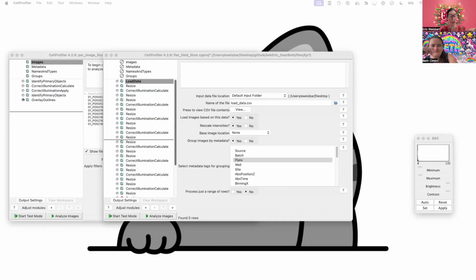And microscope objectives are still usually made by hand. So everybody's microscope objective is going to be slightly imperfect. And that's still the best way to make them, amazingly enough. So they will be imperfect because ideal lenses don't exist except in physics class. And so I thought I had an example right here.